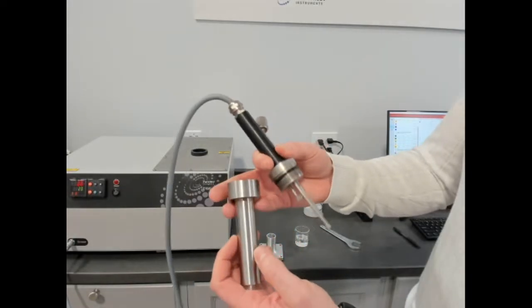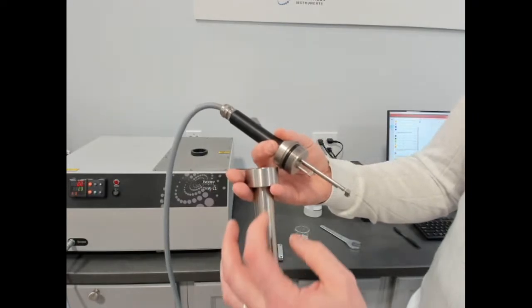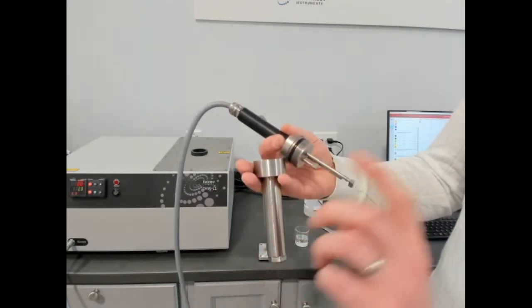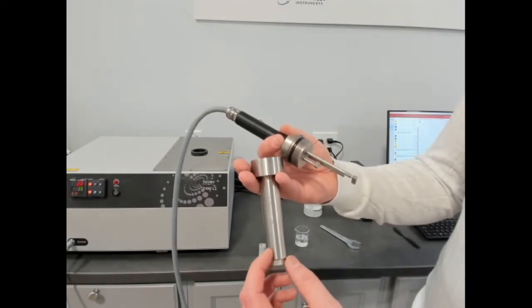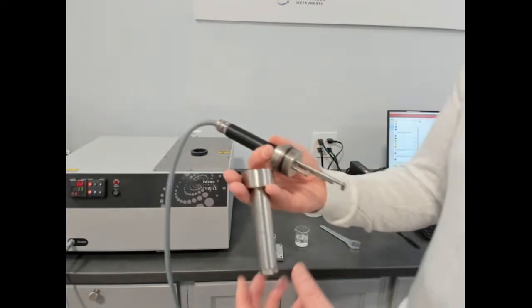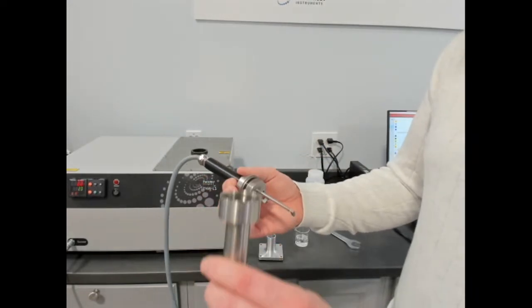One of them is observation, which is glass to allow you to look at if there's any phenomenon happening within your sample. The other one is a phase change cell that allows you to accommodate different changes in volume. And then there's a powder cell and variable density powder cell. So that holds about 20 milliliters of fluid.